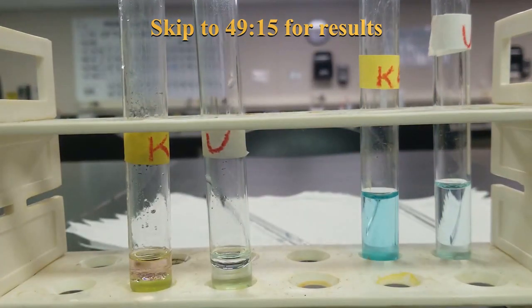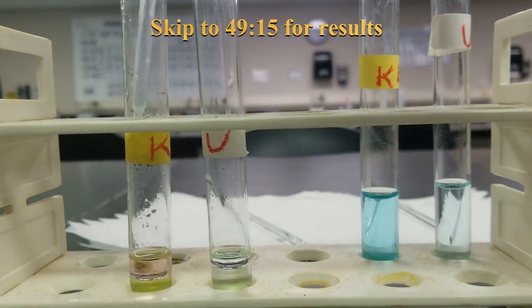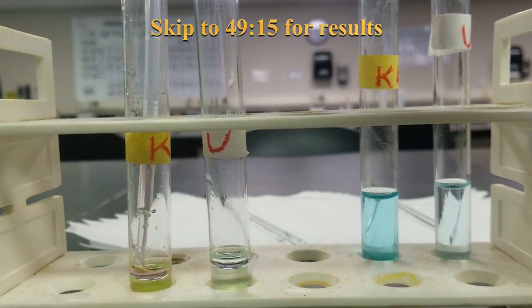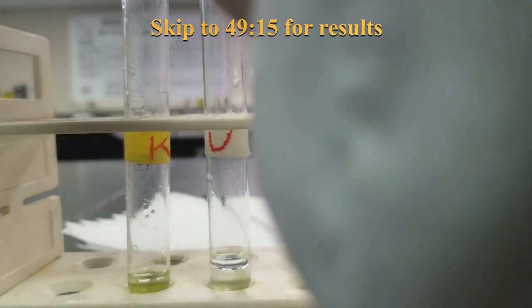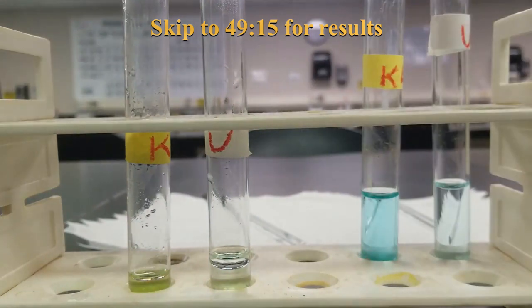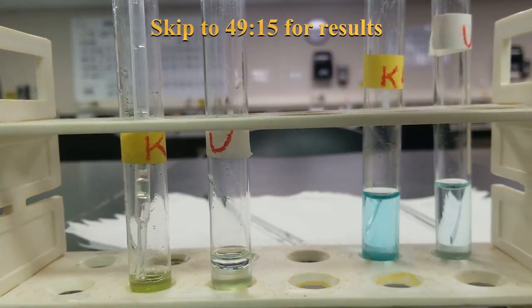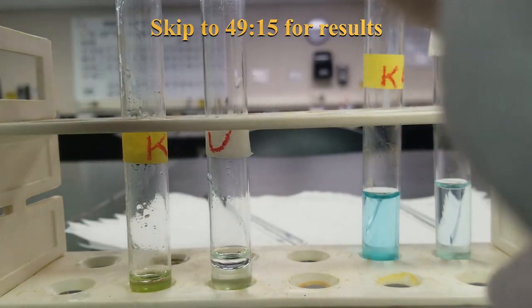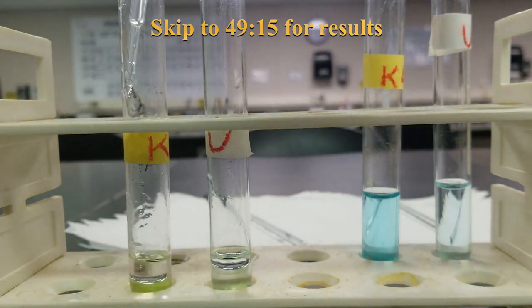Getting closer. Hopefully the last bit of toluene added right here.